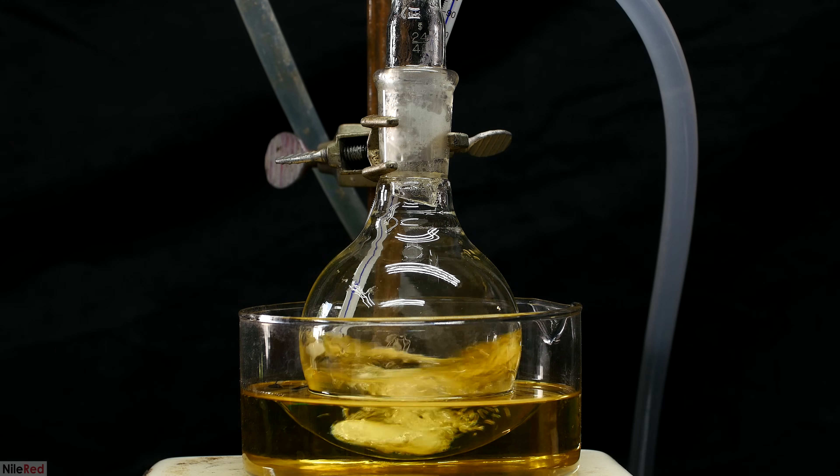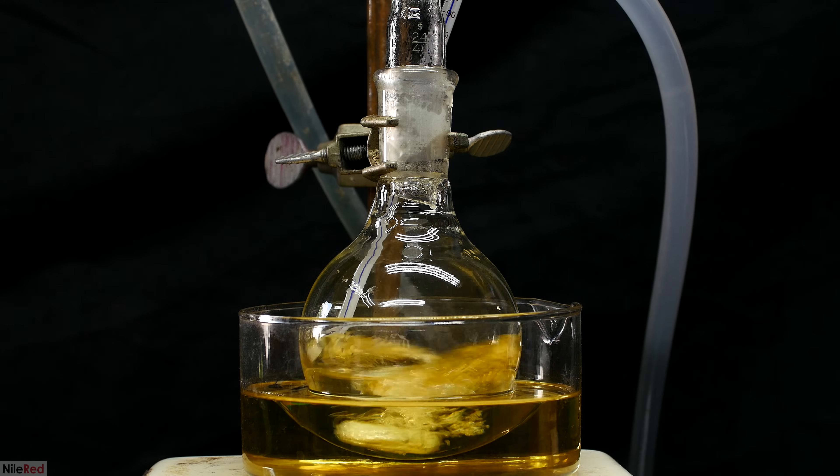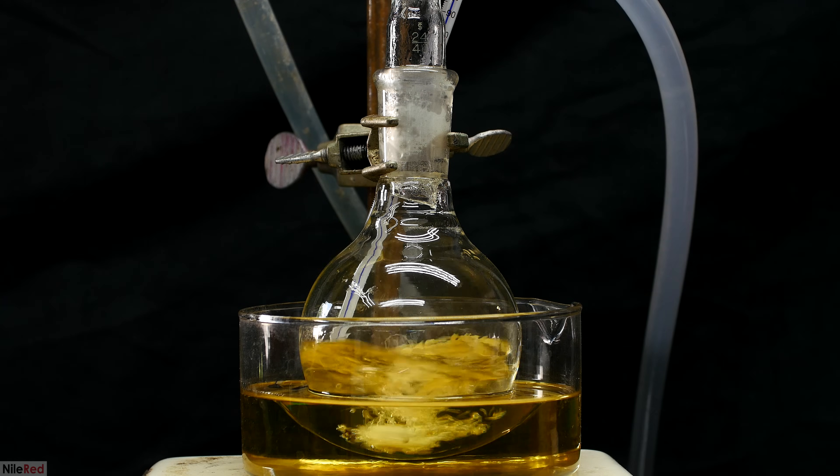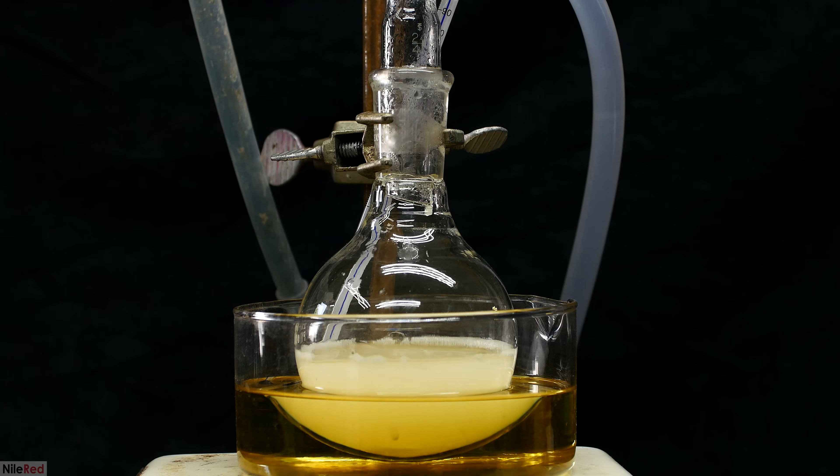The bubbling really starts to die down, and after 10 or 15 minutes it really isn't very interesting to look at. When we reach the end of the reflux at the one and a half hour mark, there's a bunch of precipitate in the reaction flask.